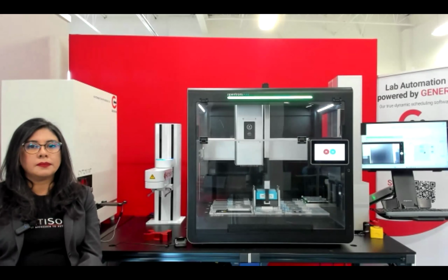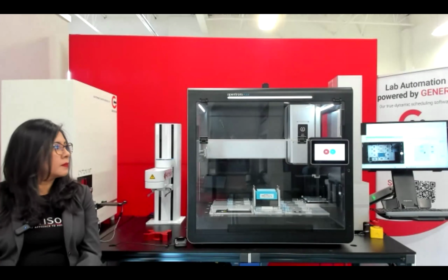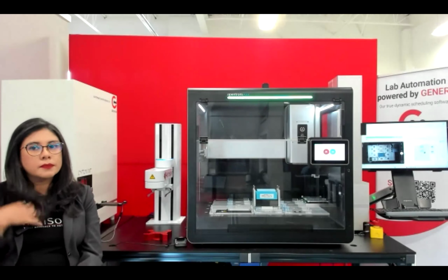Yeah, and then just to add on to that, the stacker modules are only compatible with the Flex. They don't work on the OT2. The main basis for that is that the gripper isn't present, so you wouldn't be able to utilize them in the same capacity whatsoever on the OT2. And as you said, the core structure of the protocol would be significantly different on the OT2 versus the Flex.